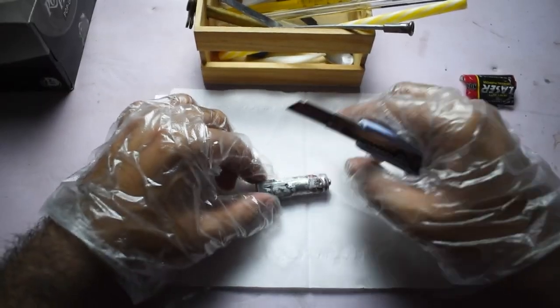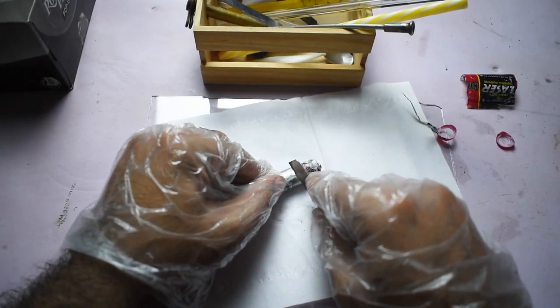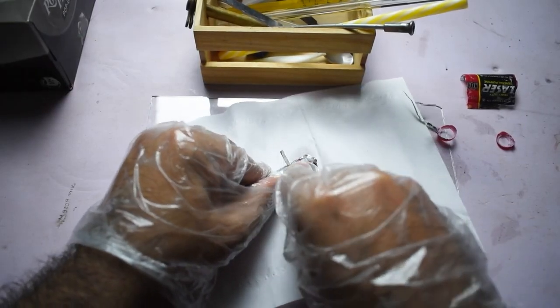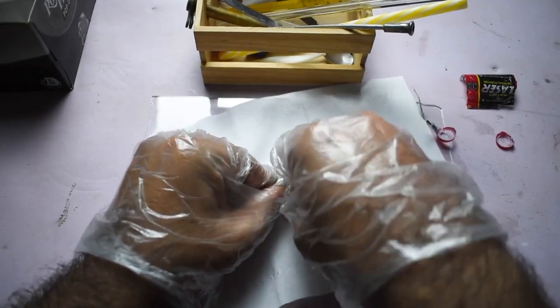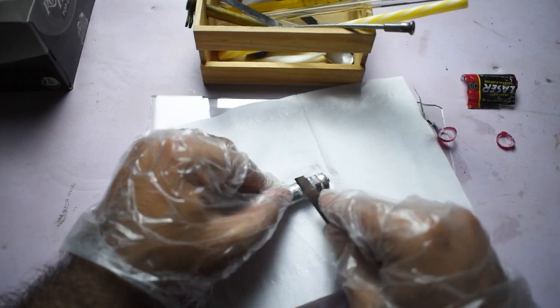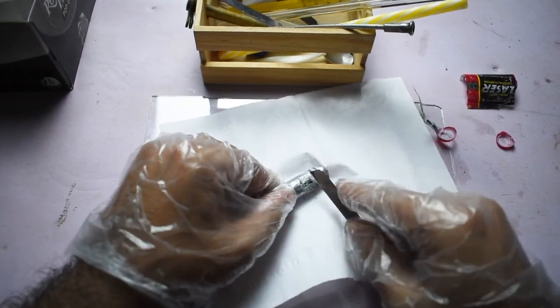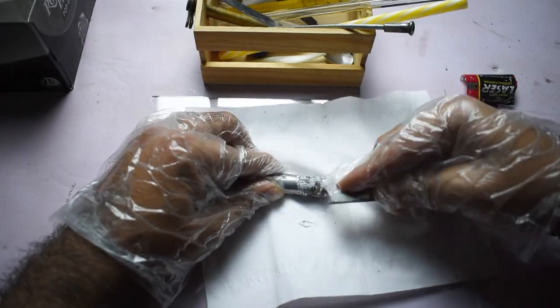As the battery operates, the zinc gradually dissolves into the electrolyte. That's why the casing of an old battery often appears thin and brittle. Much of the zinc has already reacted during the discharge process. Once the zinc casing is removed, you'll find a layer of paper underneath.